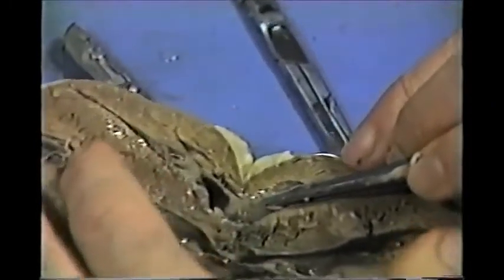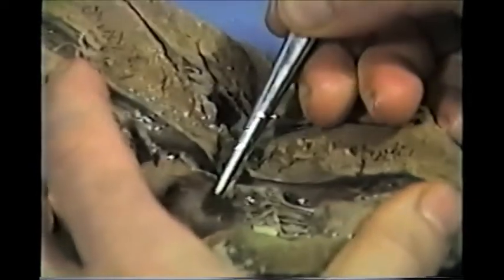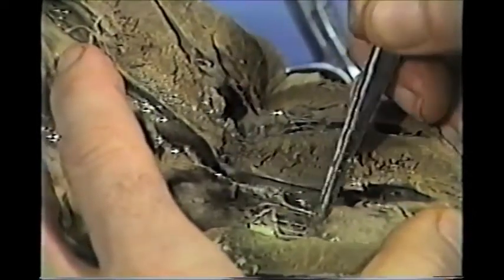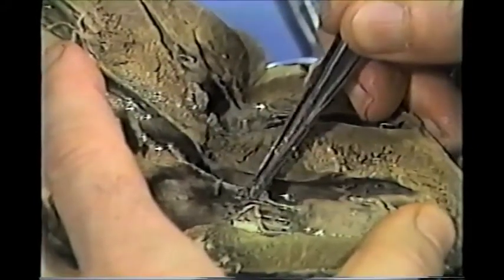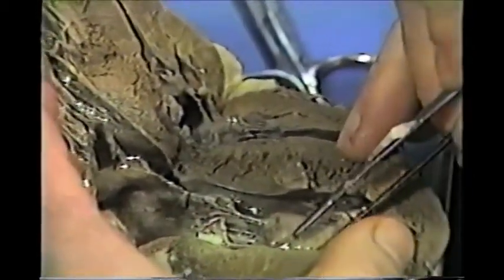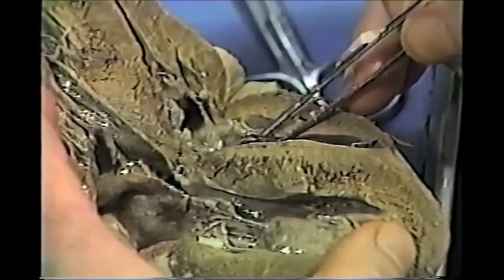If we look at the counterpart of this valve on the left side, this is the bicuspid or mitral valve. You can see that the valve flap is very thick, the chordae tendinae are much thicker, and the papillary muscles are much bigger. Everything is heavy duty on the left side because higher pressures are generated. The left side is the systemic pump — it has to pump blood through all parts of the body — whereas the right side is the pulmonary pump; it just has to pump blood to the lungs.